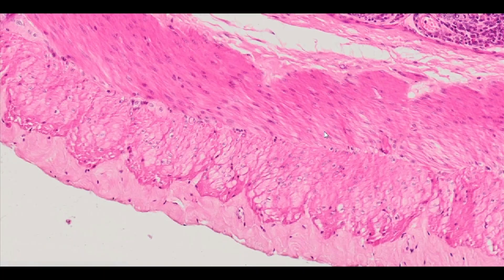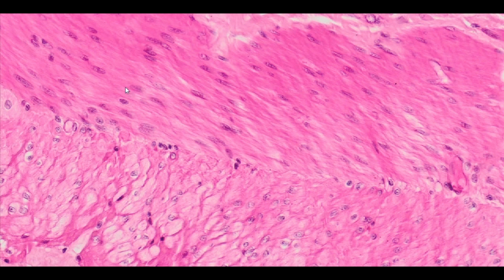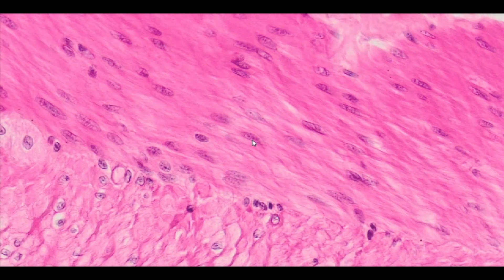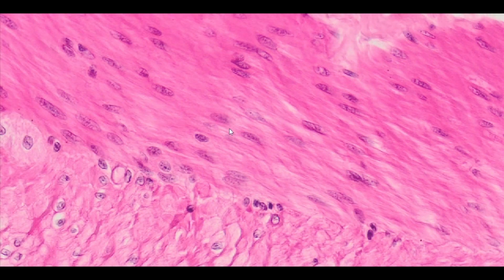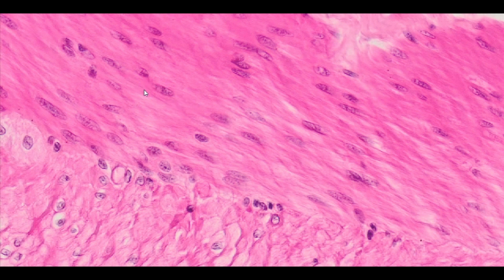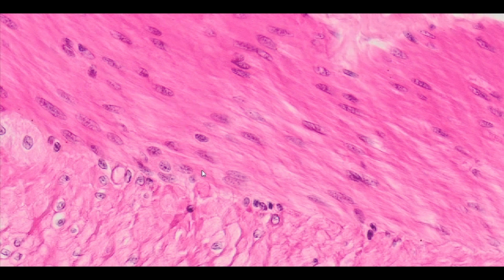In the longitudinal section of smooth muscles, single cells with a characteristic spindle shape and a centrally located cell nucleus can be identified. The morphology of the muscle cell is a specific adaptation to the function of the muscle membrane of a given organ. The spindle shape of the cells makes it possible to form a solid structure necessary for peristaltic movements.